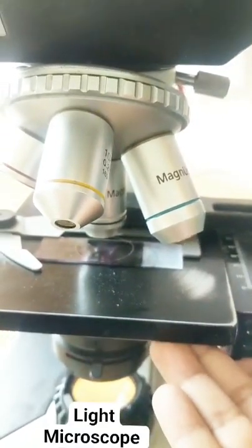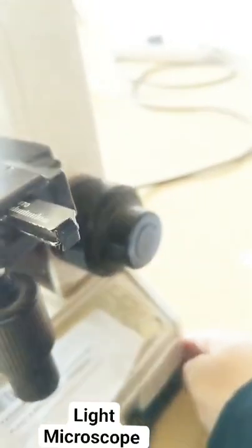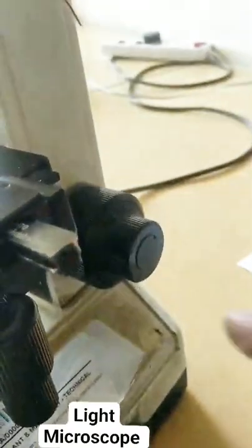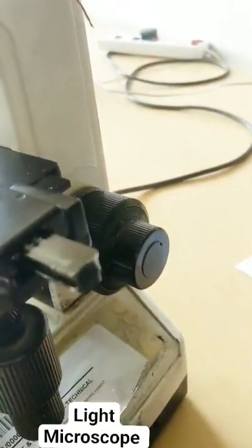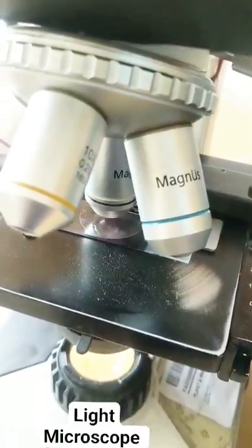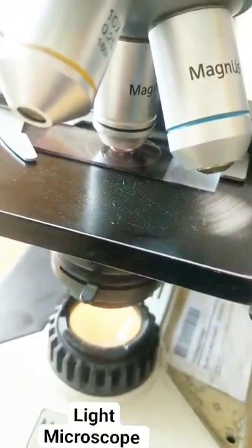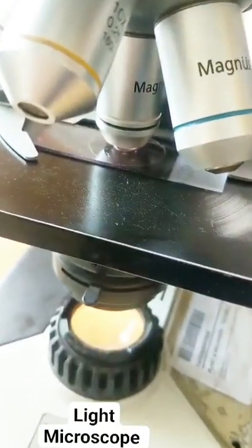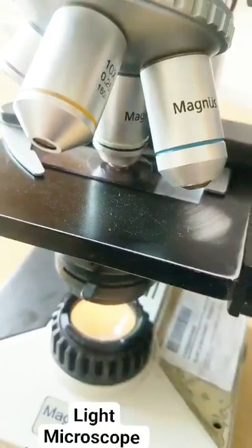How do I move the stage? On the side over here, you have these two knobs. One is the big knob and one is the tiny knob. When I move the big knob, the stage is moving — do you notice now the oil and the slide have come in contact with the lens? The big knob is the coarse adjustment.